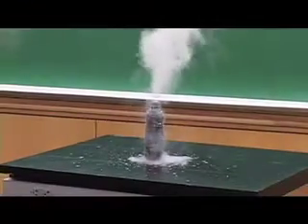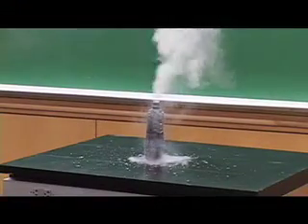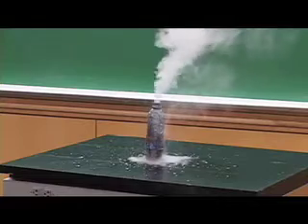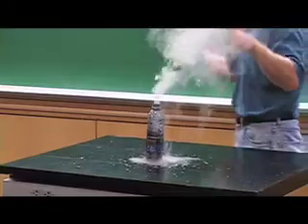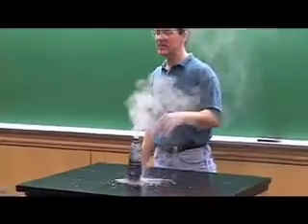We're making a little bit of a mess here, that's okay. You can also see the bottle's actually getting significantly smaller. It's shrinking. The heat of this reaction actually shrinks the bottle—you can see the label falling down on it.